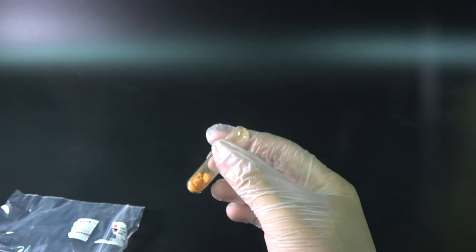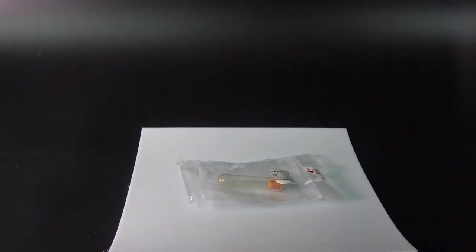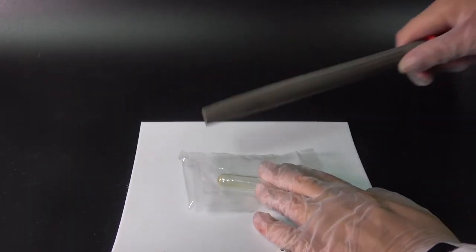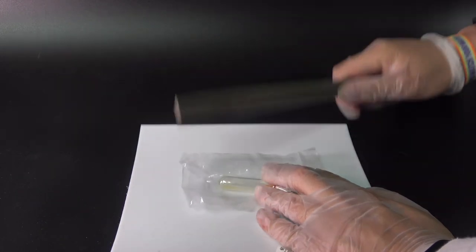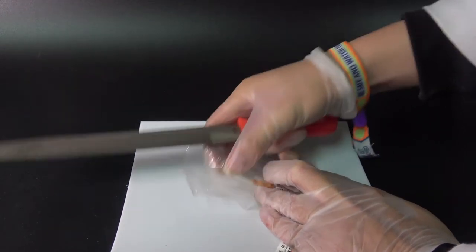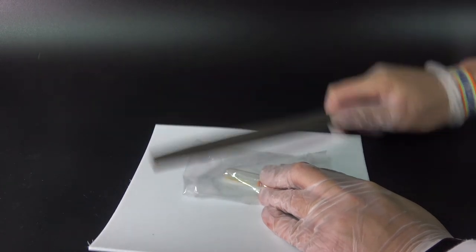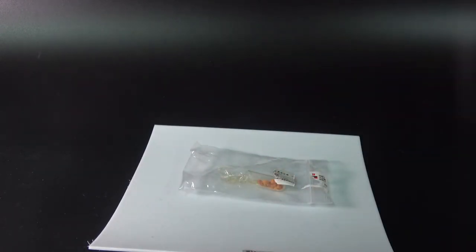Since the platinum is sealed in a glass ampoule, to get it out, we need a very special tool. And I highly advise to do this in a bag, in case if the unthinkable ever happens, everything will still be in the bag.